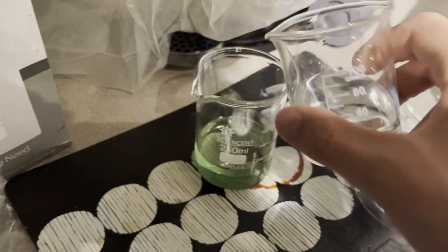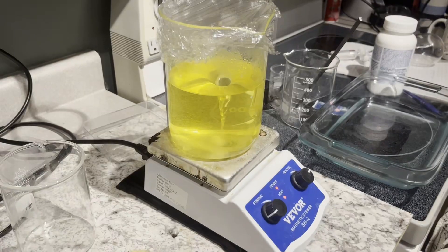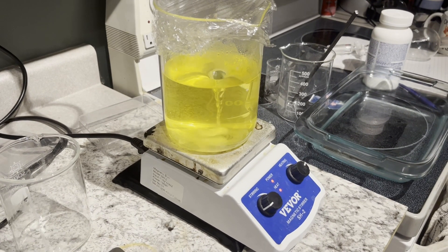Here I mix the sulfuric acid and hydrochloric acid. I'm just kidding, don't do that. I'm mixing the water in with sulfuric acid to make it a 50-50 solution.